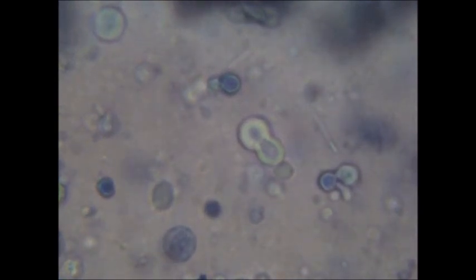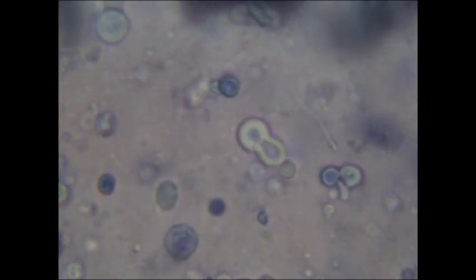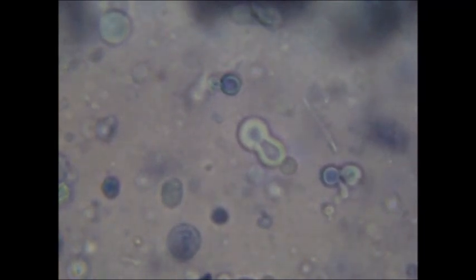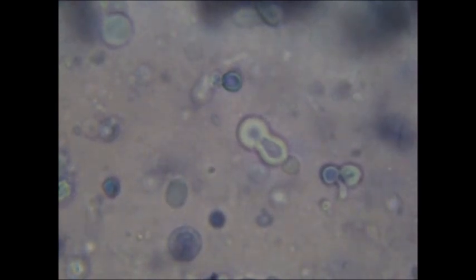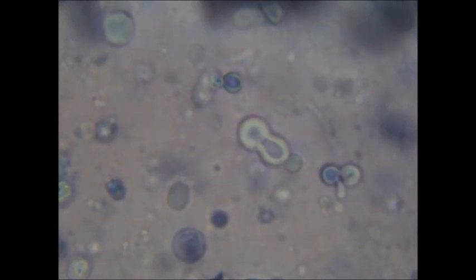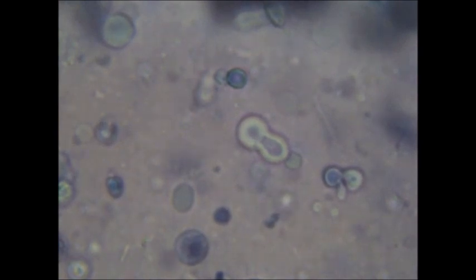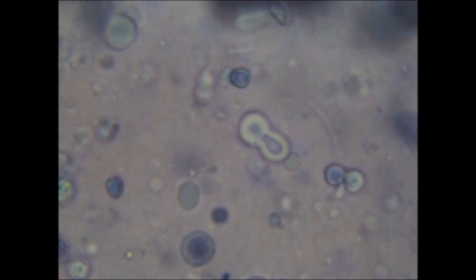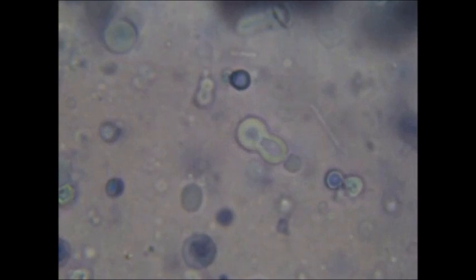This is a single vesicle which I believe is in the process of division. I've had great difficulty capturing another more clear-cut example of vesicle division. When you watch the division of a normal living cell under the microscope, the process can take hours. This may be the case also with these non-living lecithin vesicles. And also there are no shearing forces when looking at these vesicles under the microscope like there would be in a primordial ocean to cause rapid separation of vesicles.